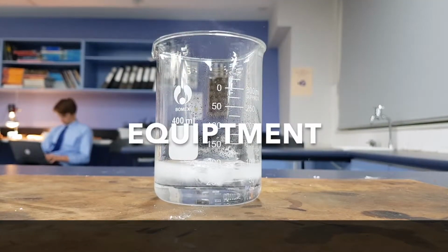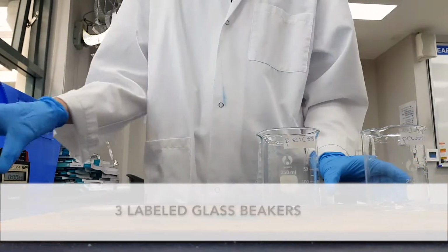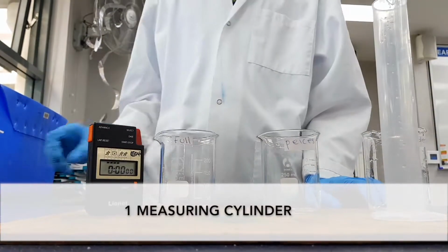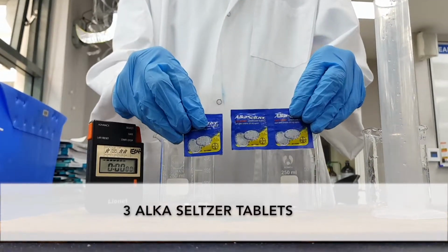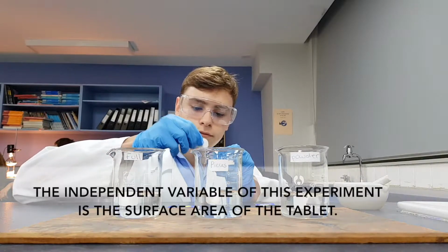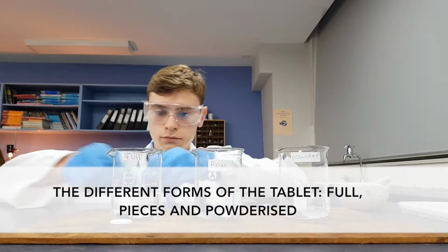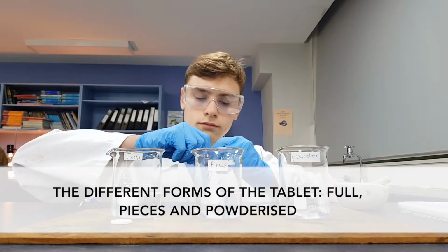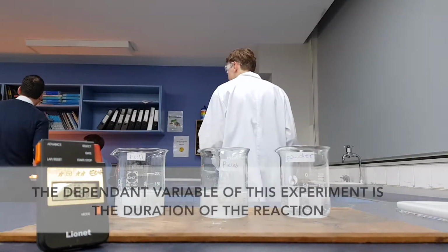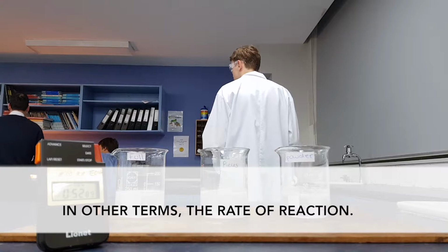For this experiment, you will need 1 heat-proof mat, 3 labelled beakers, 1 stopwatch, 1 measuring cylinder, 3 Alka-Seltzer tablets, and 1 mortar and pestle. The independent variable of this experiment is the surface area of the tablet. The different forms of the tablet, pieces and powderized, all have different surface area. The dependent variable of this experiment is the duration of the reaction, in other terms, the rate of reaction.